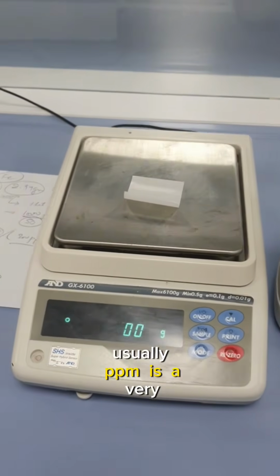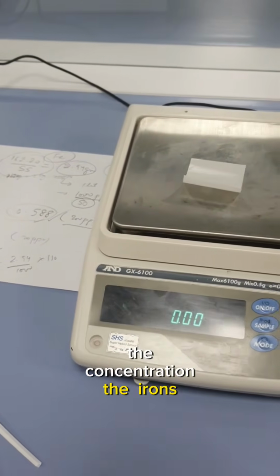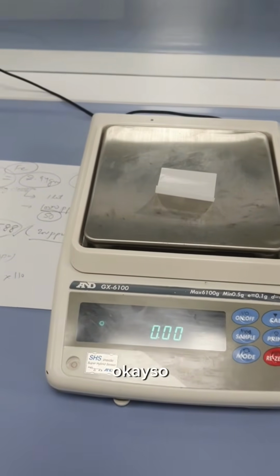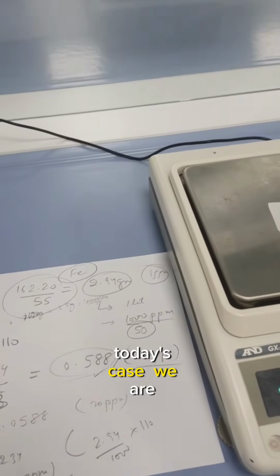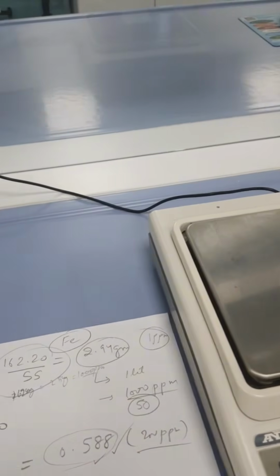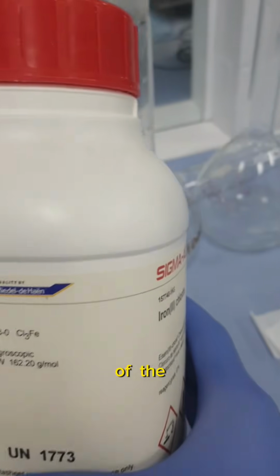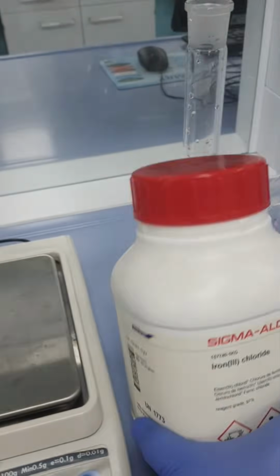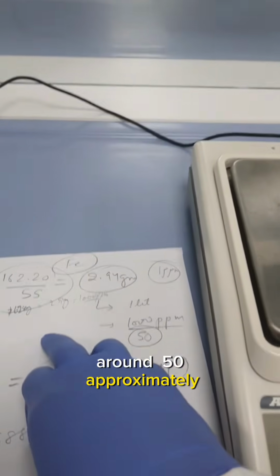So usually ppm is a very small unit to denote the concentration of the ions or metals in the water solution. Let's suppose in today's case we are preparing 20 ppm or 50 ppm of iron from the iron chloride salt. You can see the molecular weight of the iron chloride is 162.20 gram per mole, and we know that the mass of the iron is approximately 55.